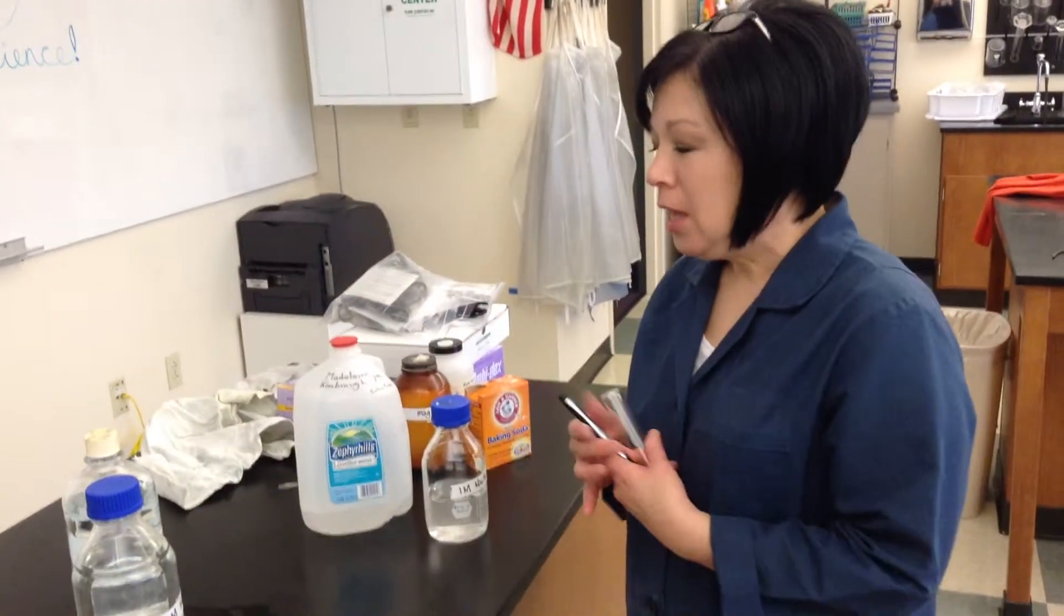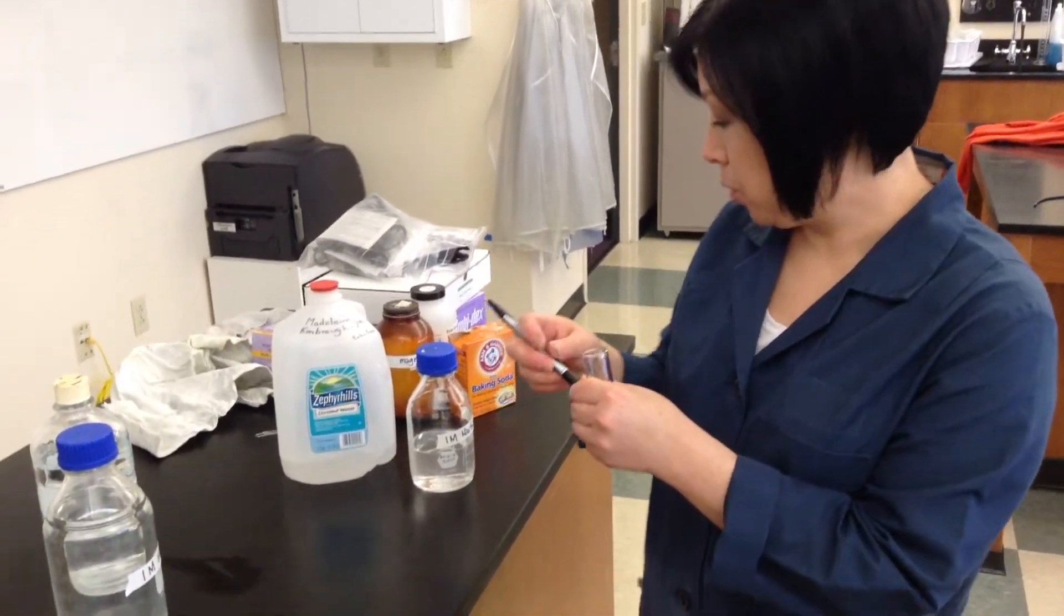Start at any time. So let's say your reaction produces a color or it gets somewhat cloudy, like this reaction will do.